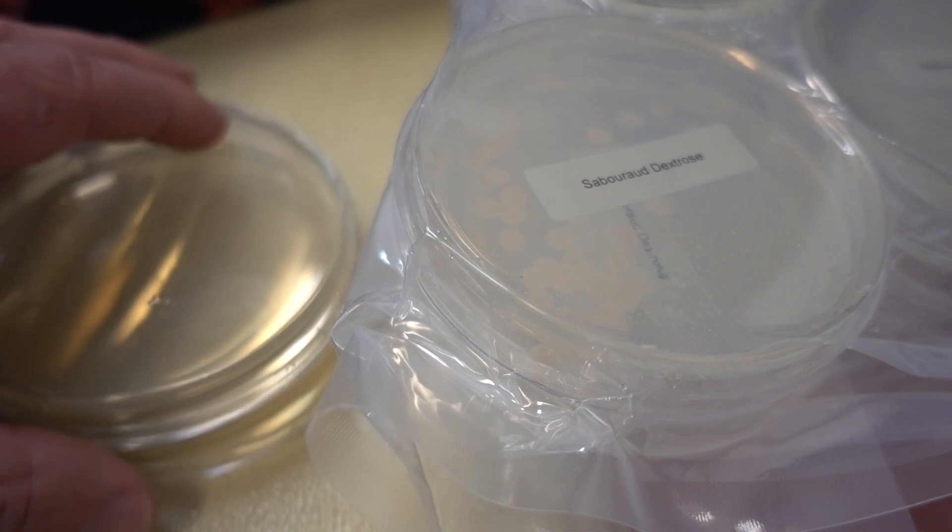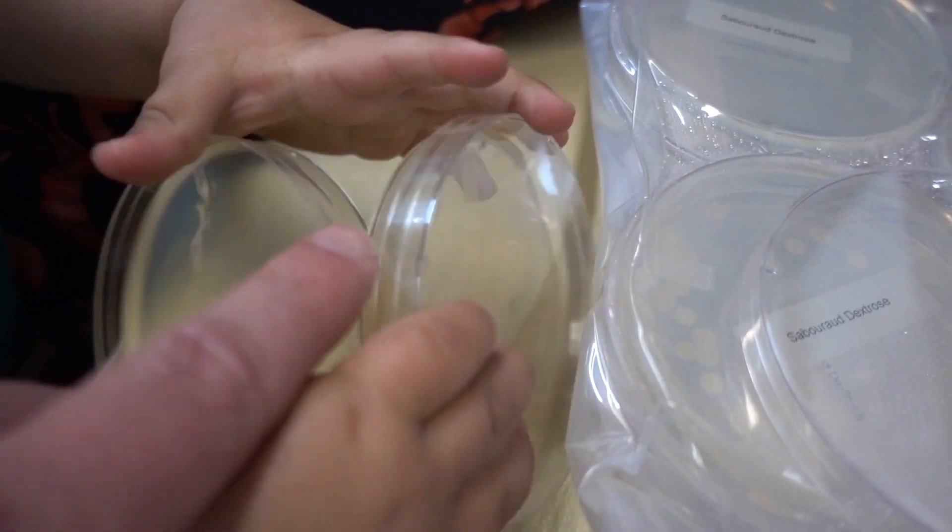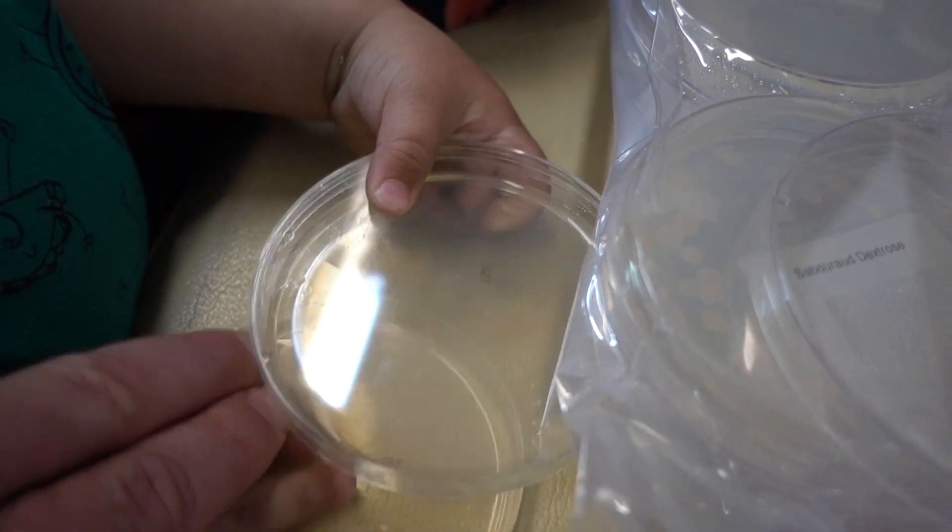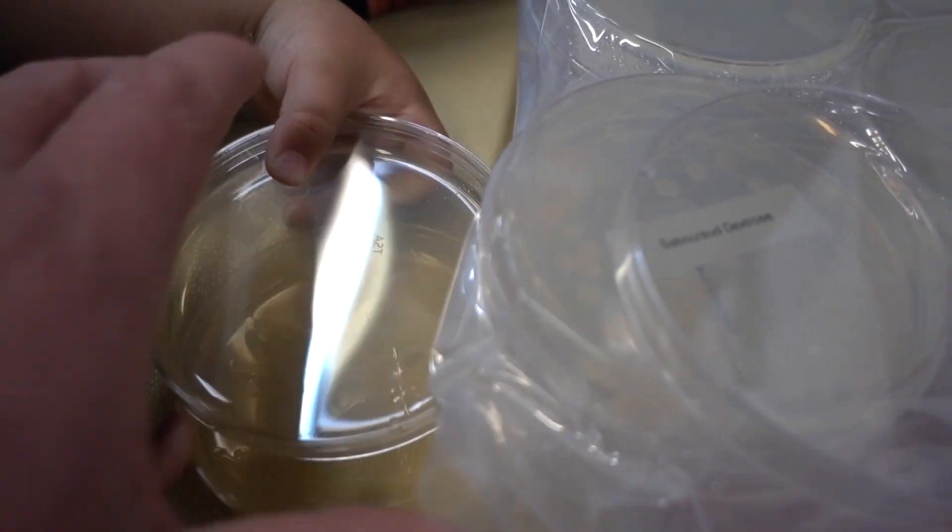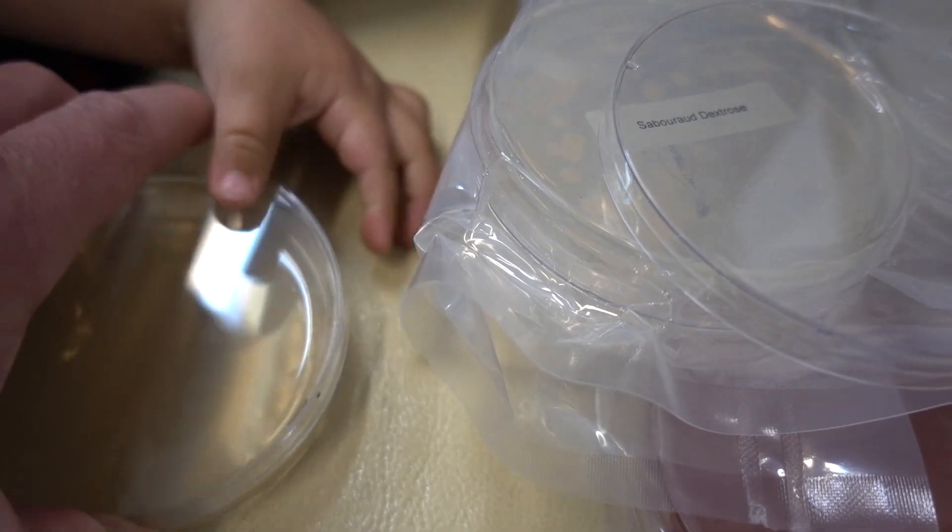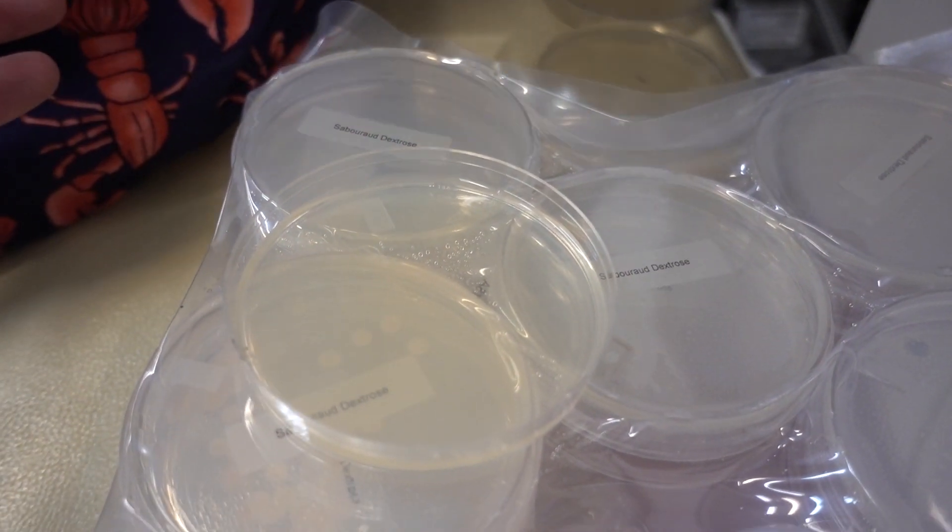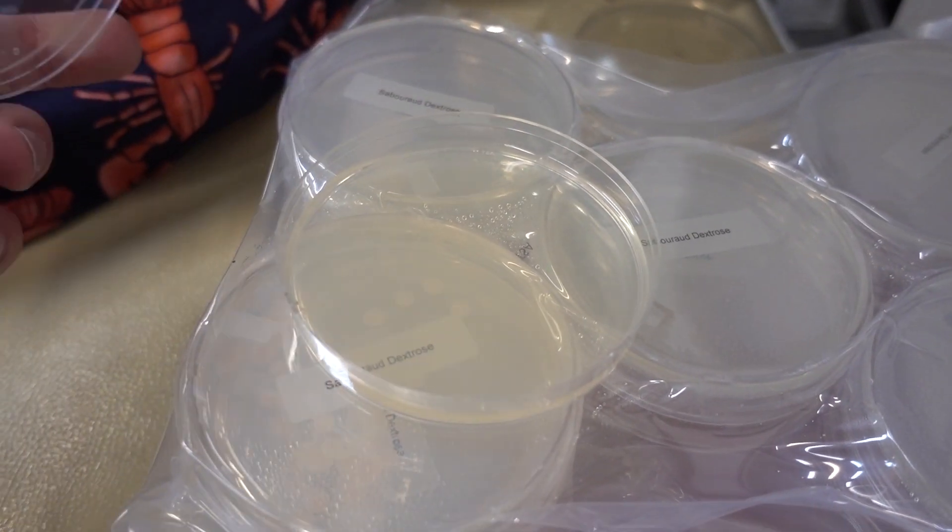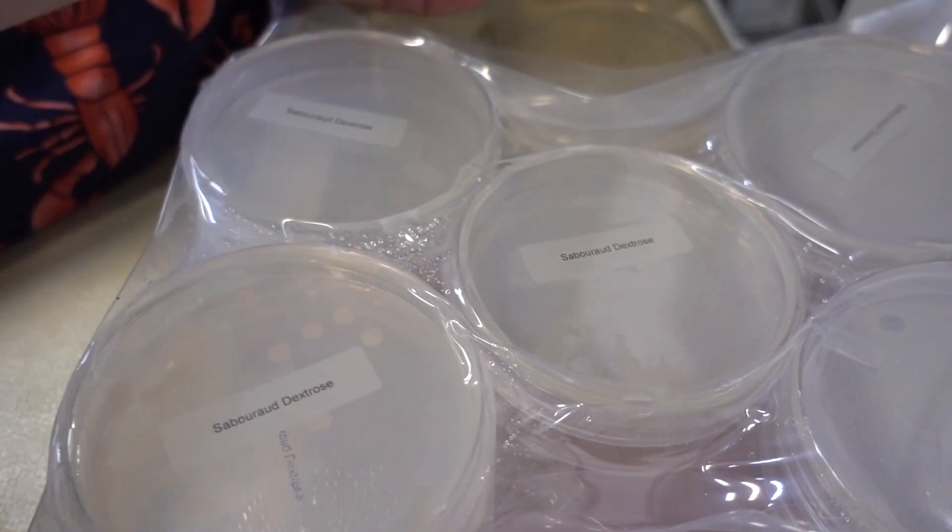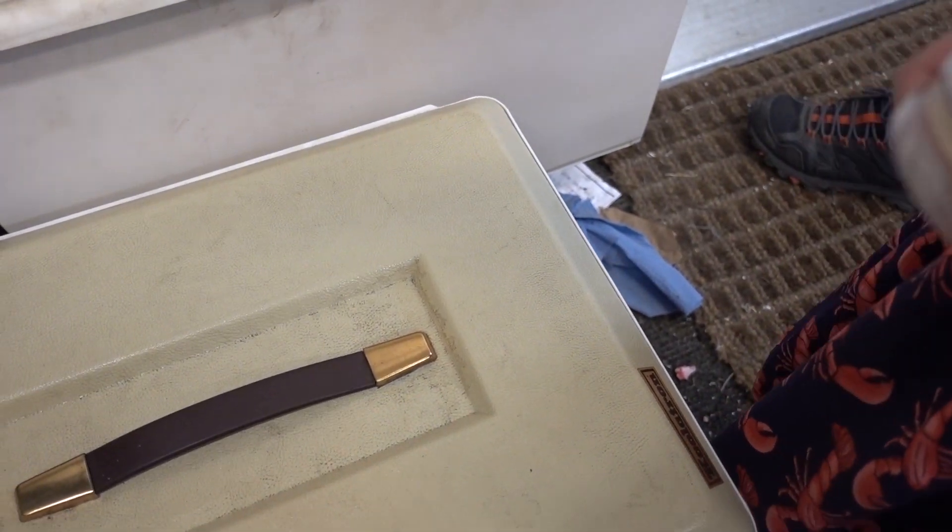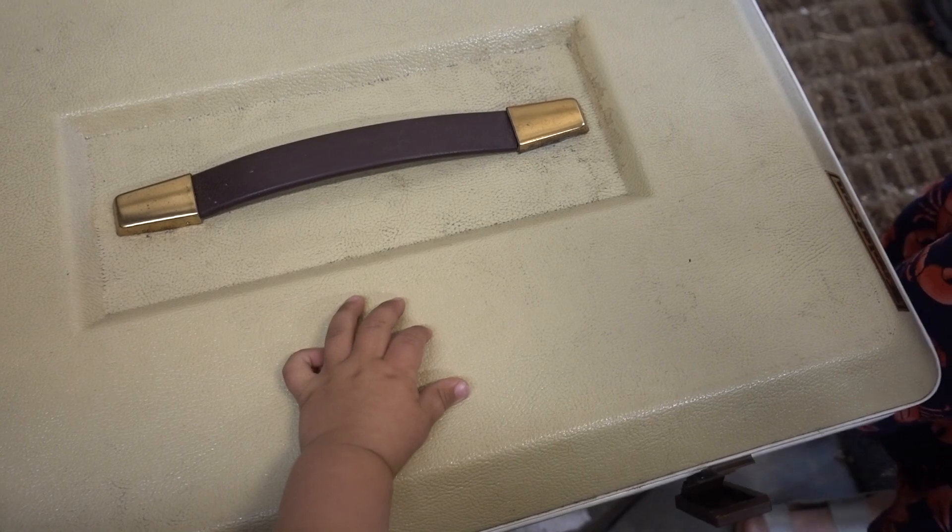Brother bear, are you ready? Touch that. Yeah, touch it. Just touch it quick. Wow, science is tough with little ones. Touch it real quick. There you go buddy. Now we're going to put it away. And this is our control. We're just going to open it up. Don't touch it. Just open it up. And then whatever falls on there will tell us whatever's in the air.